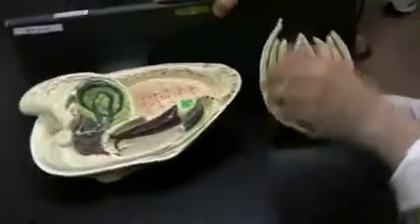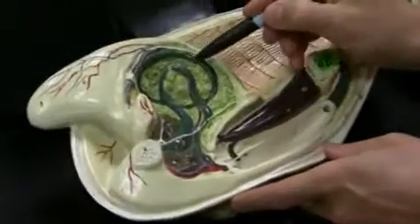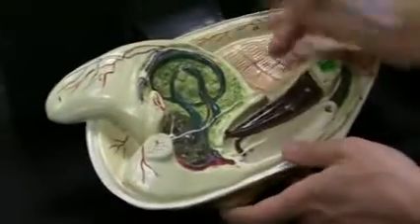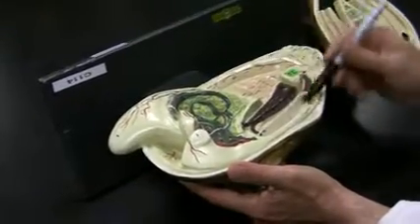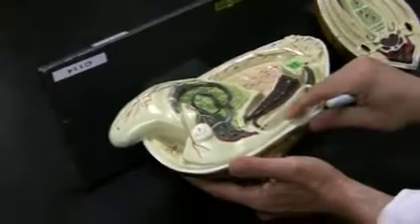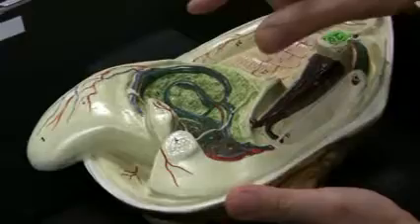Okay. Same thing again. Can you see it? Are you getting it? Okay. Foot, cross section. Intestine, longitudinal cut. Cross section, longitudinal cut of foot. Intestine. Can you guys see this? Intestine. Gonads. And of course it comes through the heart. The heart was broken, a broken heart. And then pericardium, kidney. Is that right?